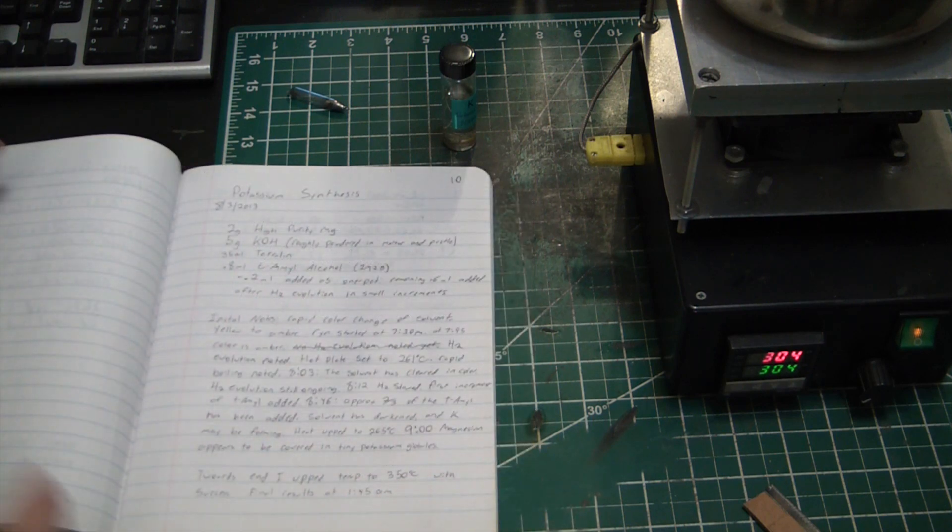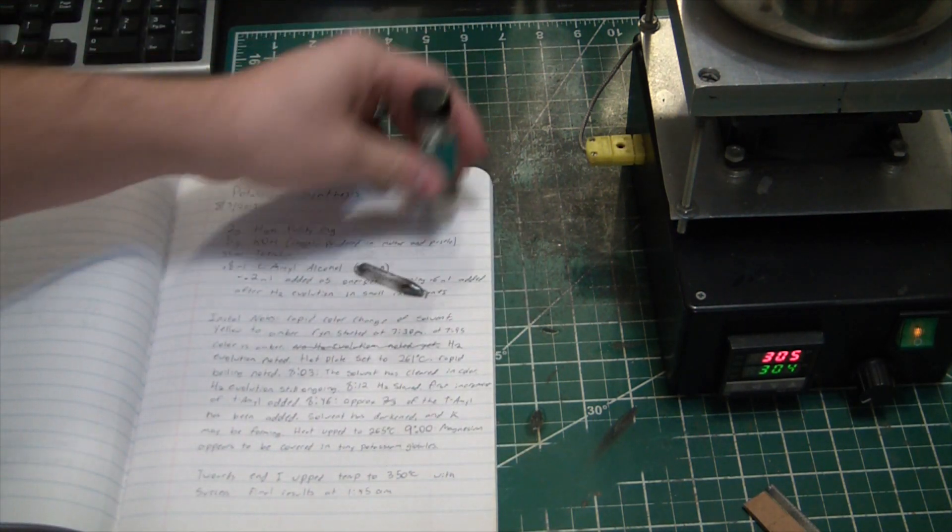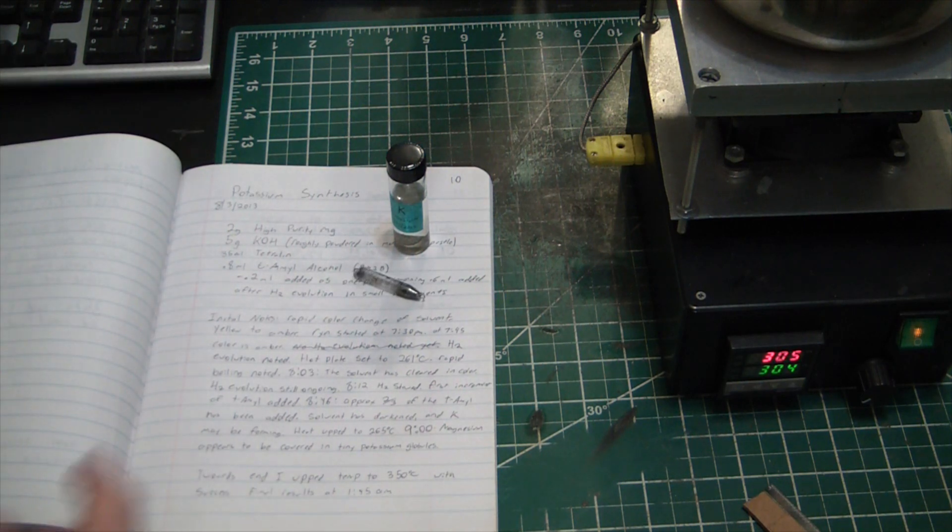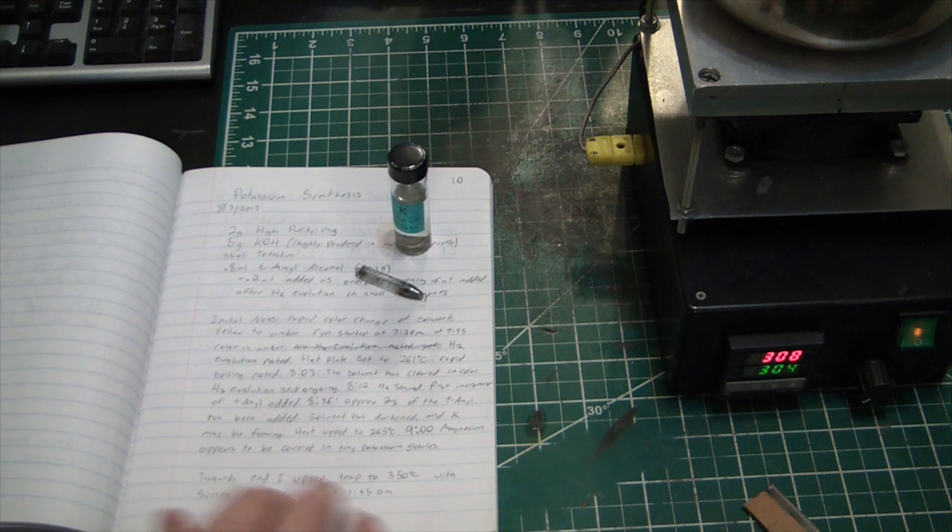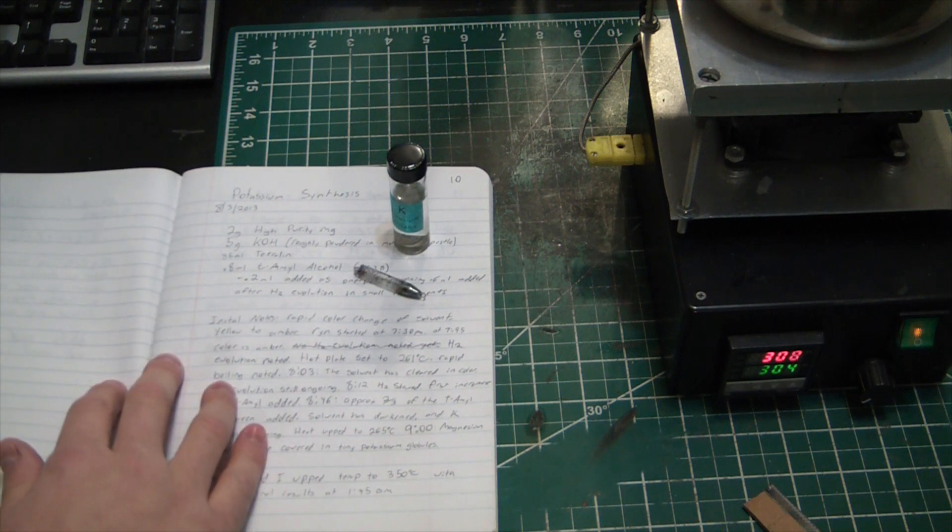Giving credit where credit's due, I originally saw this reaction or isolation on sciencemadness.org. There was a huge thread on it and tons of different people trying different things. And I tried several different grades of magnesium and realized that the purity of your magnesium is super super critical for this reaction to be successful.